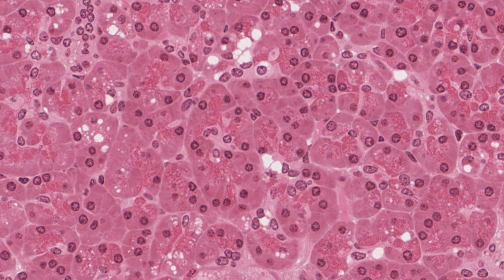They have to secrete some water as well. The trypsinogen, chymotrypsinogen, nucleases and other enzymes obviously don't just sift through the ducts as a powder, but their main product is proteinaceous. Actually, it's the duct cells that secrete most of the water. And the many pale stained cells are centroacinar cells that I mentioned earlier.